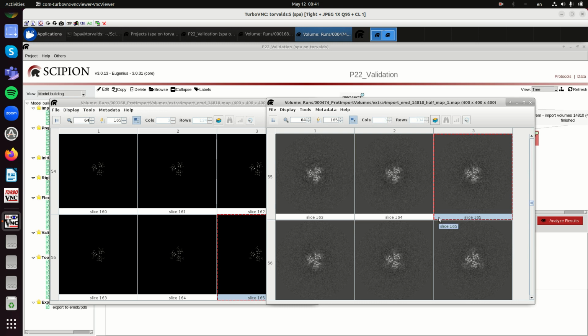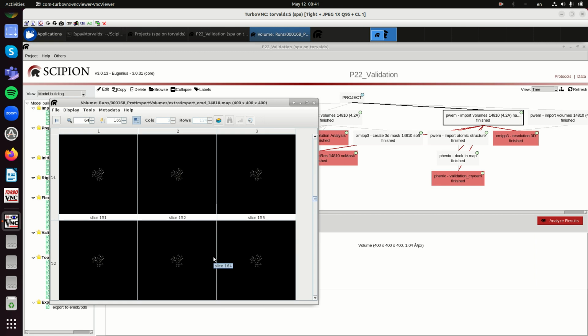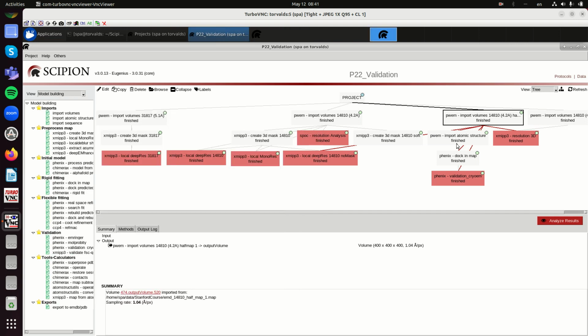So what is the right structure? What is the structure and the reconstruction, the quality that we have been able to reconstruct? And this one we will see that it is a bit artifactual because of the tight mask. When you apply a mask to a signal, the Fourier transform of the mask is convolved with the Fourier transform of the signal, and then you are artificially creating a correlation in Fourier space.